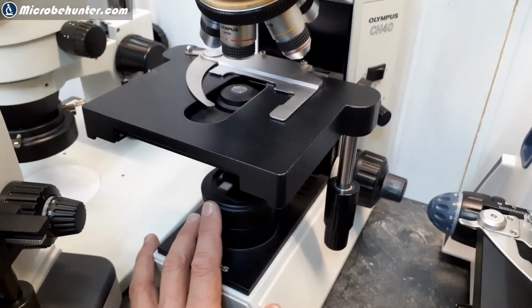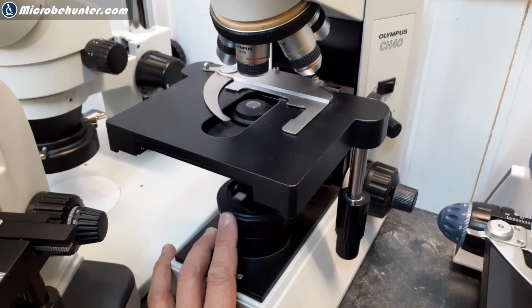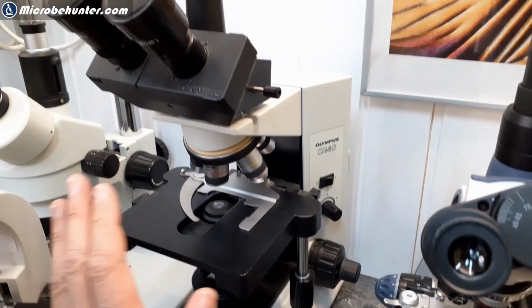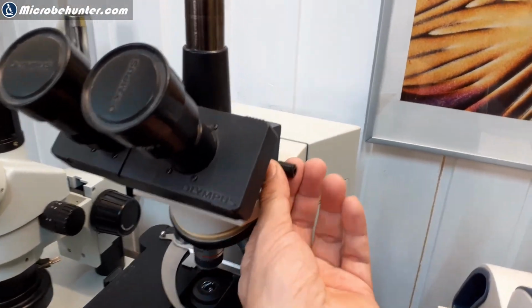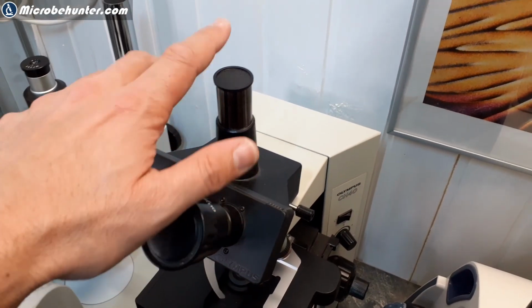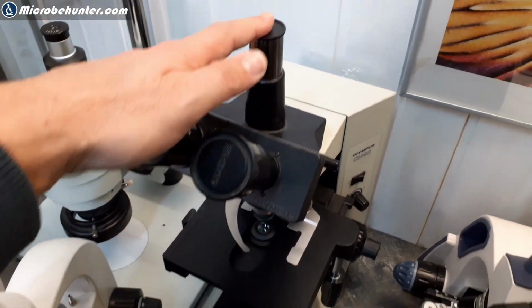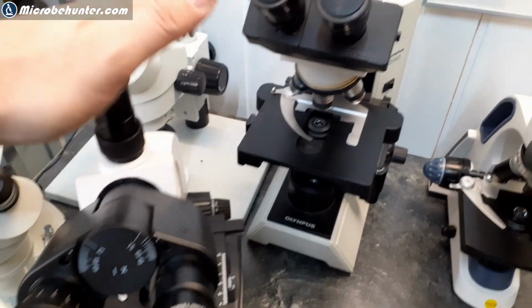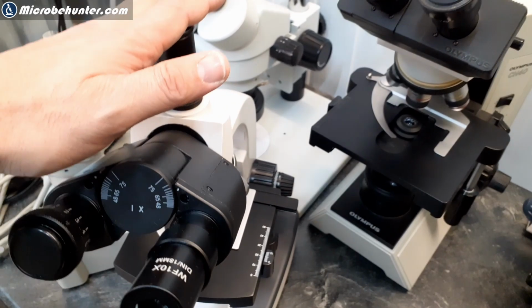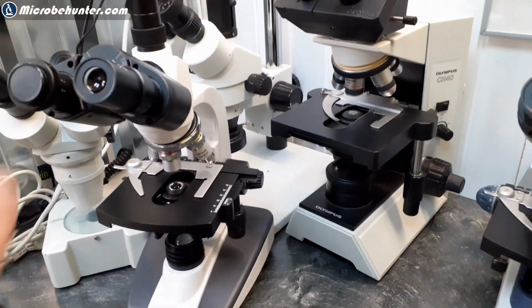Nowadays, most microscopes have LED. LED also has certain advantages. Yeah, but doesn't matter. This lever over here is able to redirect the light either out of the eyepieces or out of the photo tube. But otherwise, you see that the features of this microscope, which cost me several thousand, and one that costs now only several hundred, are pretty much the same.